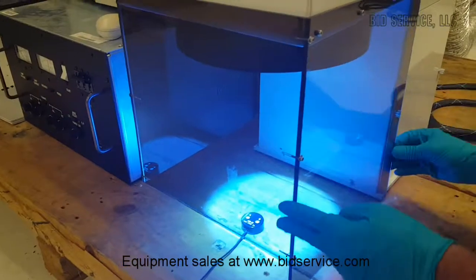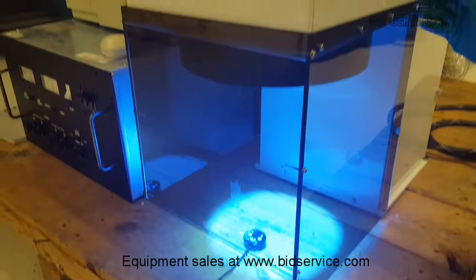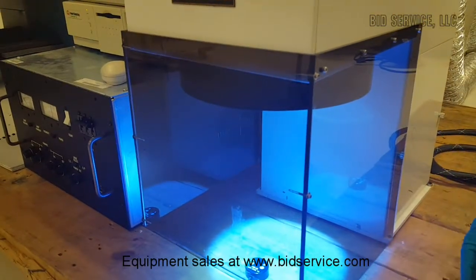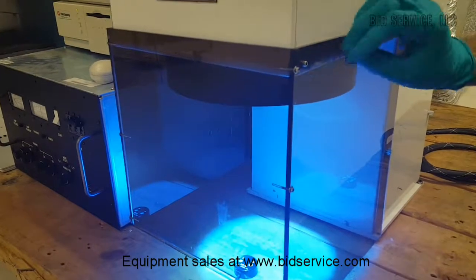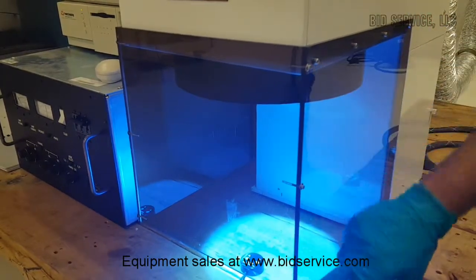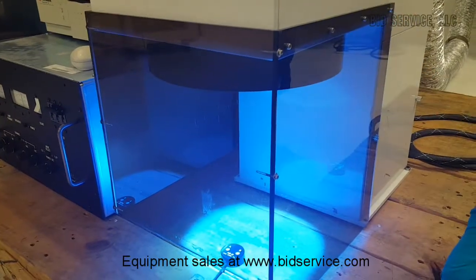It's important to leave the shield on unless a big item is to be placed inside. In that case, I recommend using thumb screws in place of these Allen screws and then use the system.